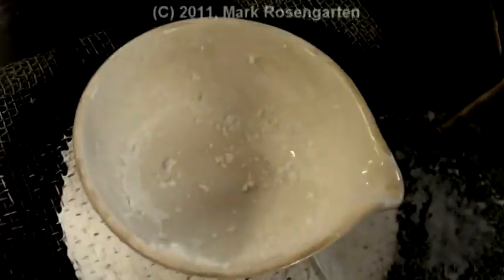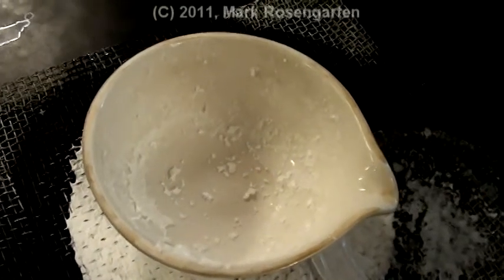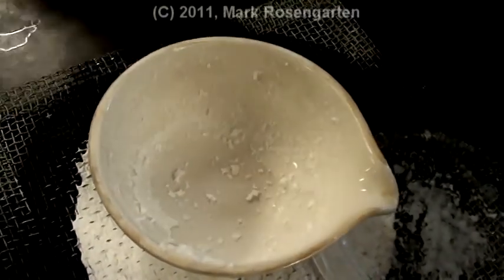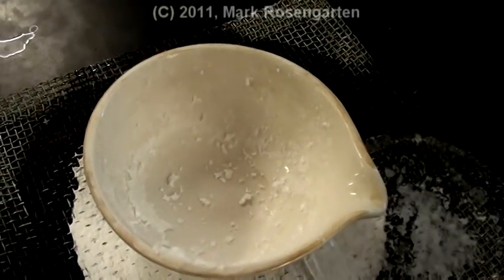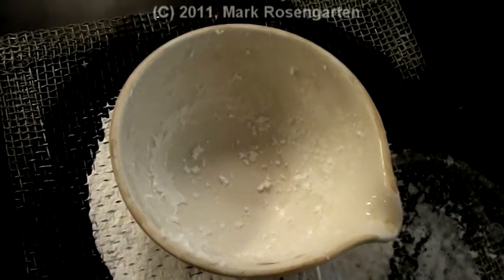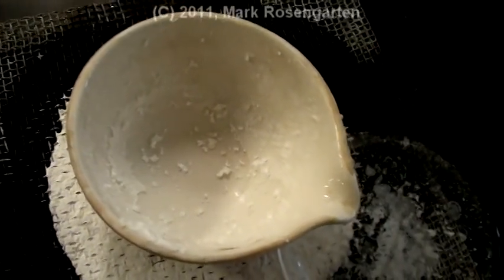Condensation. And what's left in the dish is solid sodium nitrate. The water is removed. The solvent is gone. All that remains is the solute. And when it cools off, this can be cleaned out with a scrubby brush and returned to the side.